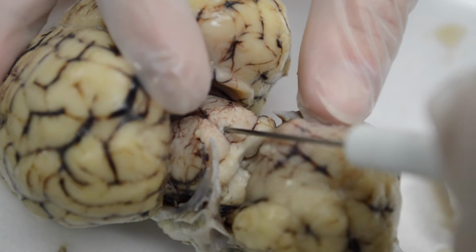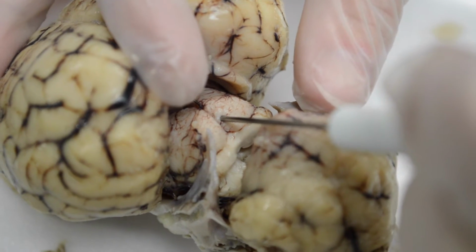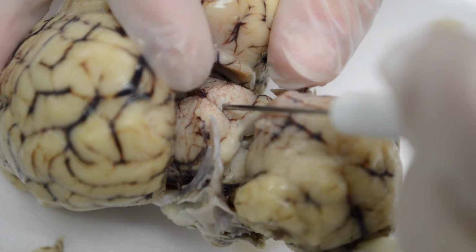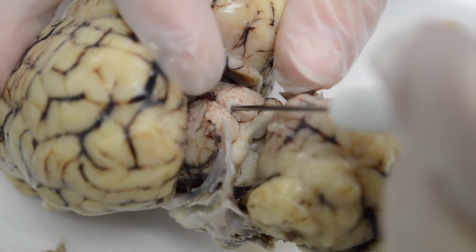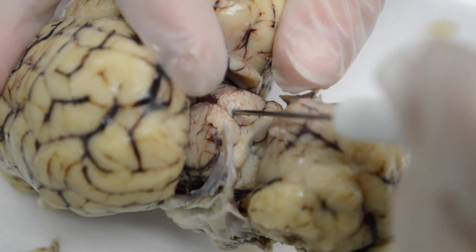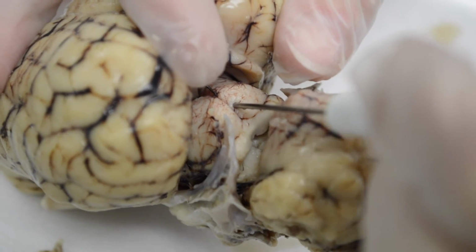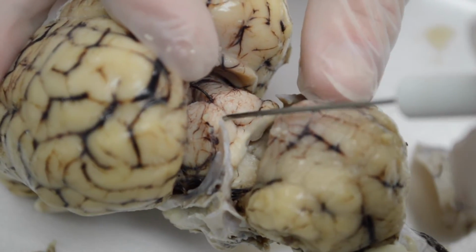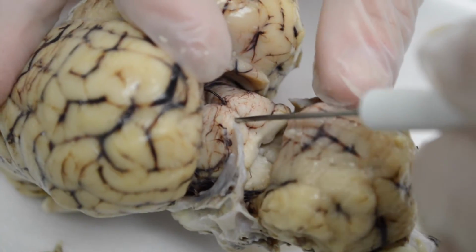The superior colliculi help with tracking, so it has to do with vision, things that you see, either movable or immovable objects. So you're watching something move with your eyes, or your eyes are moving across a page as you're reading a sentence. It is the superior colliculi that help with that visual tracking.